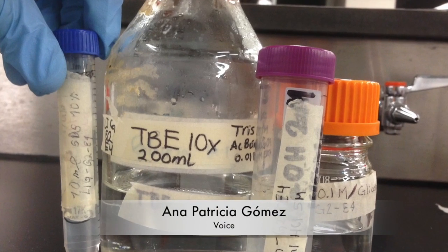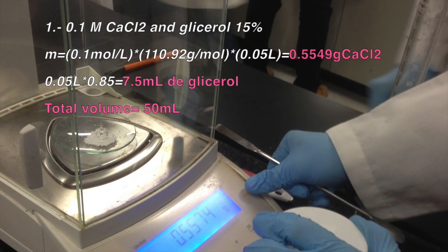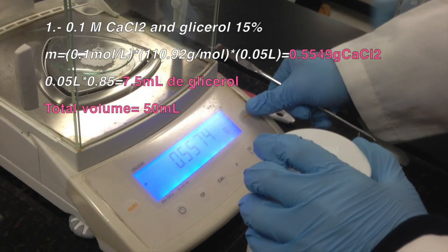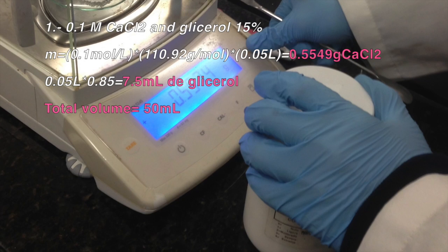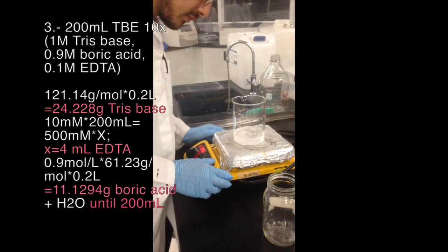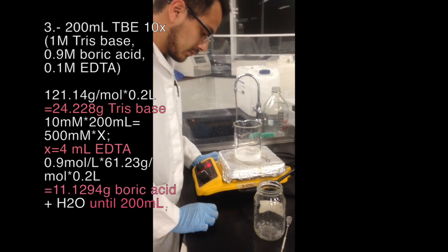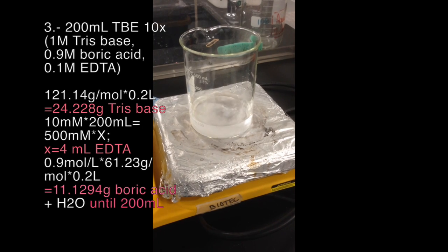Our team prepared 4 solutions. For the first one, to 7.5 milliliters of glycerol and 0.55 grams of calcium chloride was added water until a volume of 50 milliliters. A vortex was used to dissolve glycerol. For the second one, 1 gram of SDS was added to water and water was added until a volume of 10 milliliters.